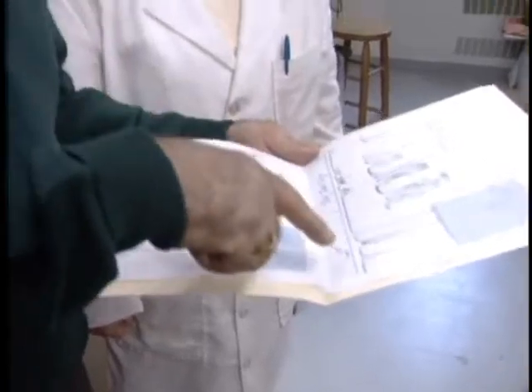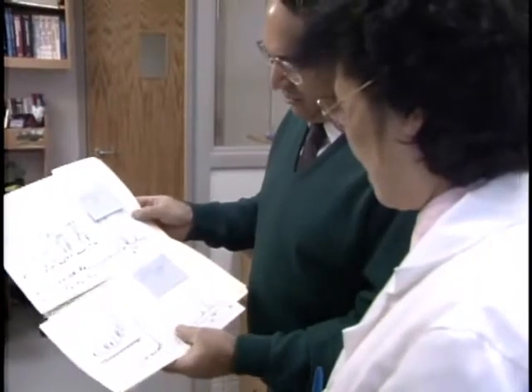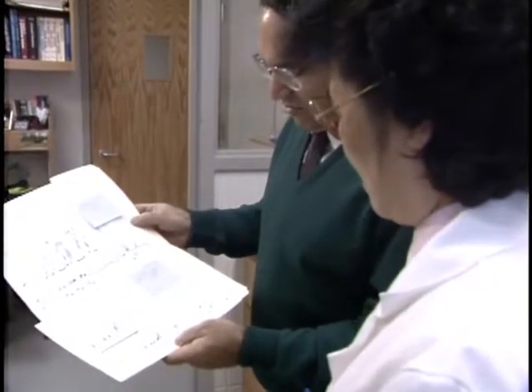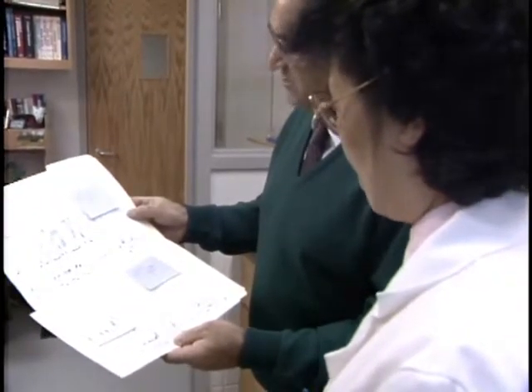This is the acid that we have right now. And that's good. That's the NMR, and this peak is for the COOH, and then we have the benzyl derivative. This is the starting compound. Look at that shape, very clear. Then you take the starting compound, hydrogenate it, and you get the acid.